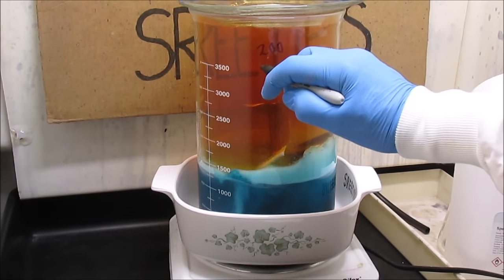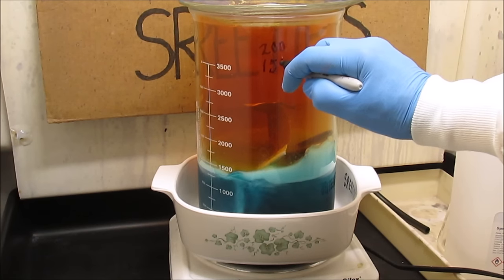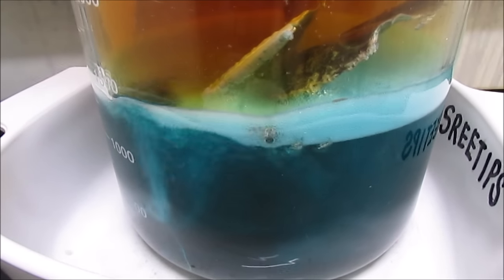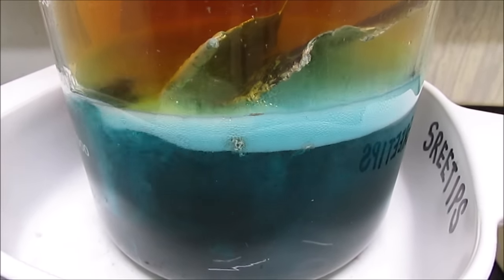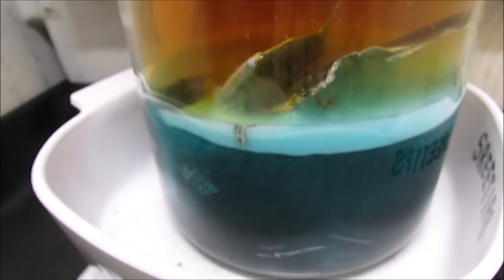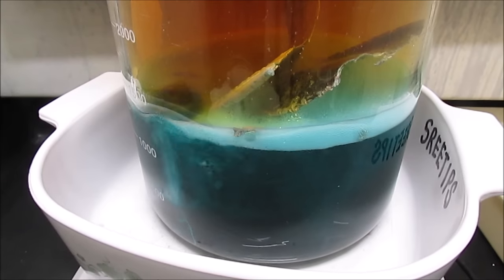I've got 350 ml total in there so far — the first dose was 200 ml and the second dose was 150 ml. Here you can see some cement silver that has dissolved and then cemented right back out of the solution onto the base metal in the plate there. Those are pieces of cement silver floating around in that solution.